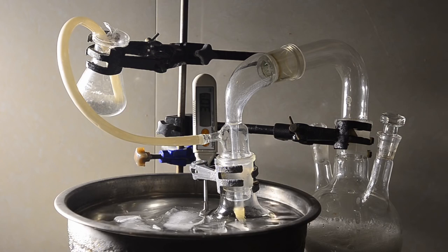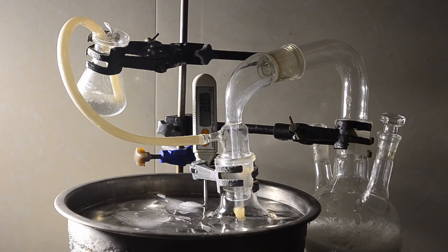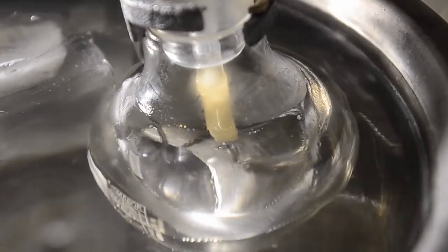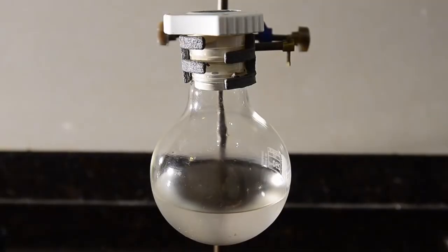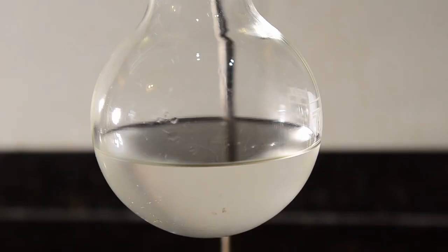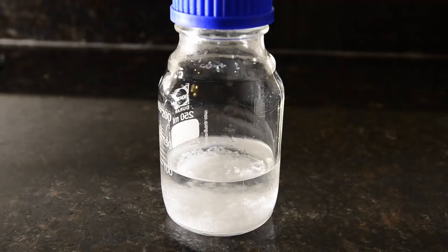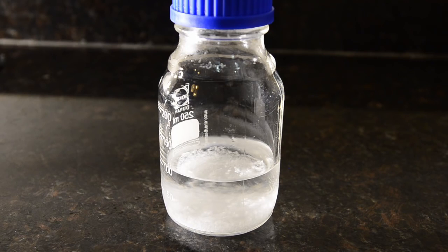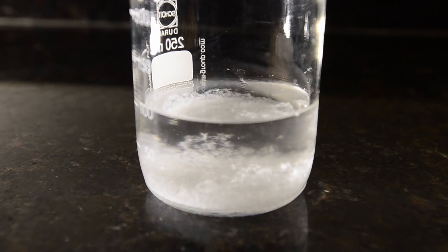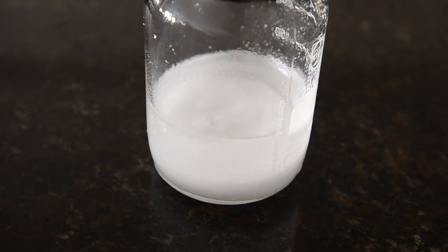Total addition took around an hour and a half, then we left the apparatus running for a further 30 minutes to ensure all HCl had been generated. Even at the end we noticed that HCl was still dissolving. We then dismantled the apparatus, stoppered the reaction flask, and quickly poured the contents into a storage container without allowing it to warm up, then placed it in a freezer overnight. After about two hours we noticed crystals starting to form — quite pretty, like tiny snowflakes. After 12 hours of chilling at below zero degrees, the bottom and sides of the container were covered in crystals.